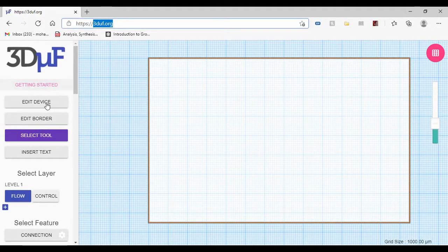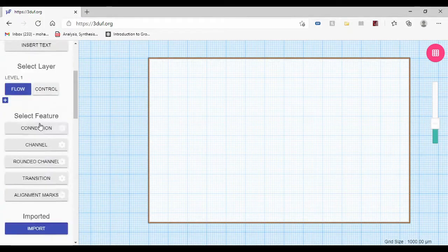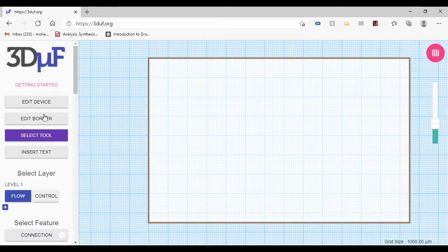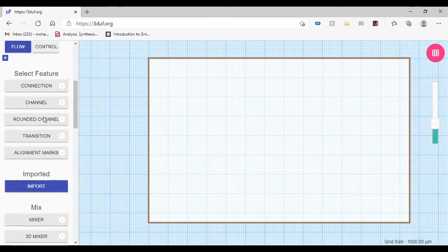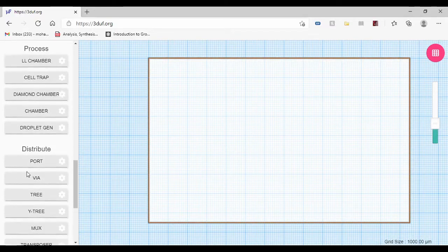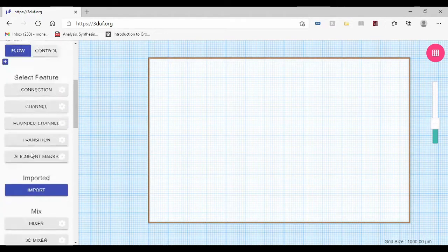Now, this website is really good because it has all the basic tools you need. I'm not going to go in depth on each different tool and how to use them. But I'm going to give you the basic startup so that you can design something simple and export it to the laser machine or the CNC software that you're using.